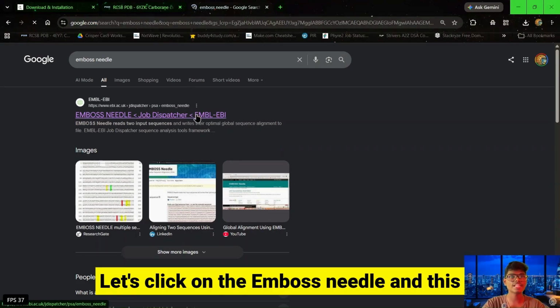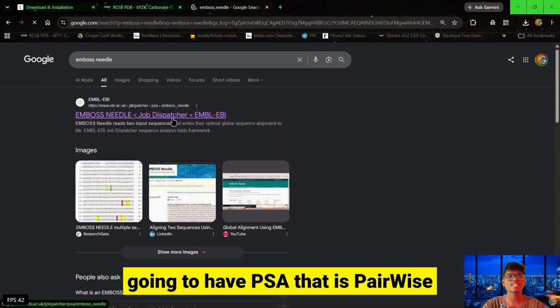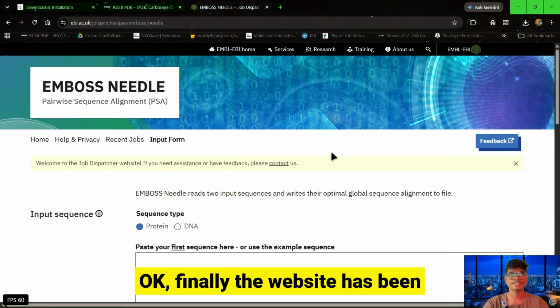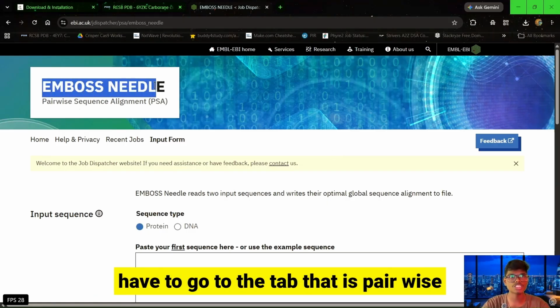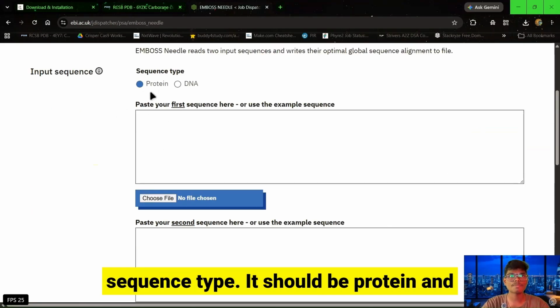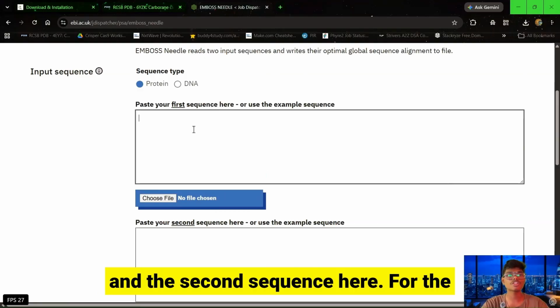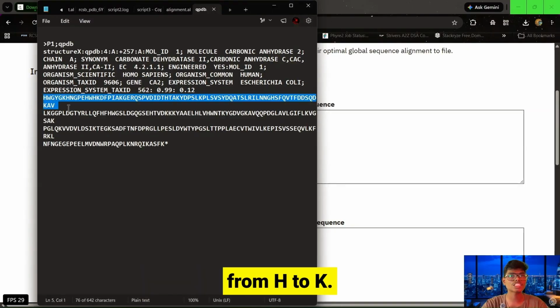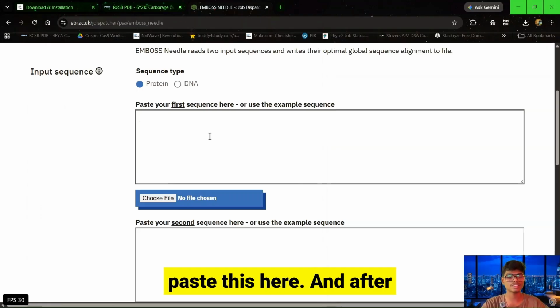Let's click on EMBOSS Needle, and this will redirect to the page where we have PSA, that is pairwise sequence alignment. Let's wait for this. Okay, finally the website has been refreshed, and here you will find an interface named EMBOSS Needle. Go to the tab pairwise sequence alignment, and you will find the sequence type. It should be protein, and you have to drop the first sequence here and the second sequence here. For the first sequence, we refer to the .seq file, and we have to copy the content from H to K, and then paste it here.